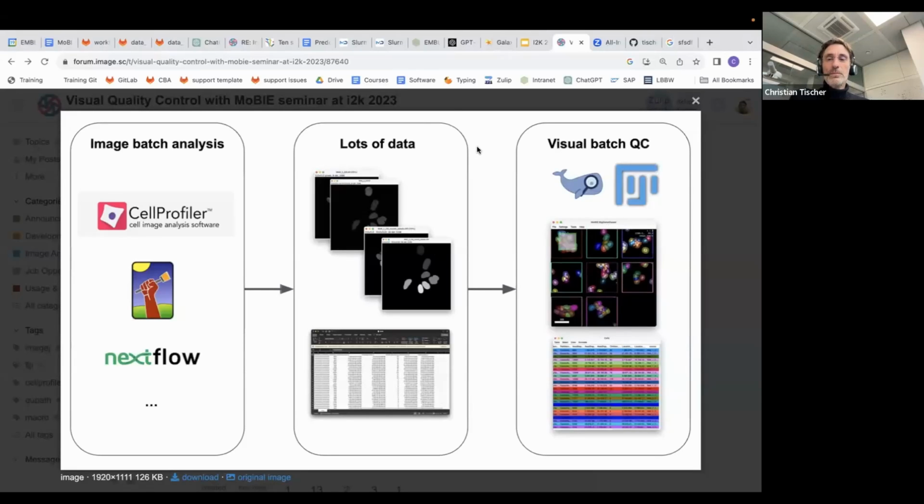And for this, we actually changed the MoBIE plugin in Fiji a little bit. So this was originally developed for something else. Some of you might know, but I will not go there now. But basically we realized one can also very nicely use it for this use case. And then you can, we think, conveniently browse through all this data and do visual QC. So that's the idea. And we will today now demonstrate that for data that comes from CellProfiler, and then I will do that, and then Dominik will show for data that comes from Ilastik, and then we can have a discussion together.